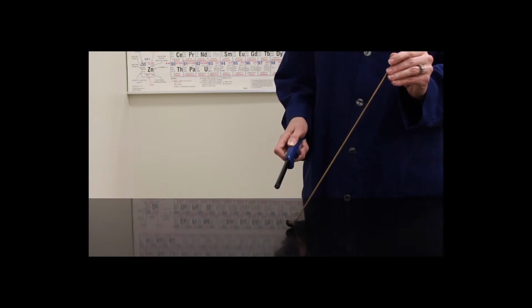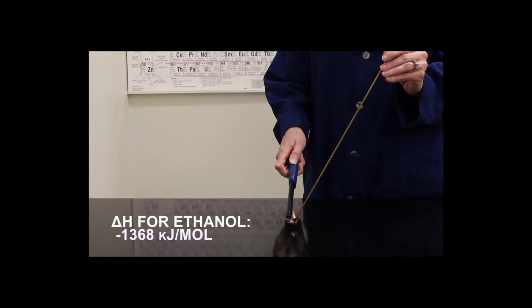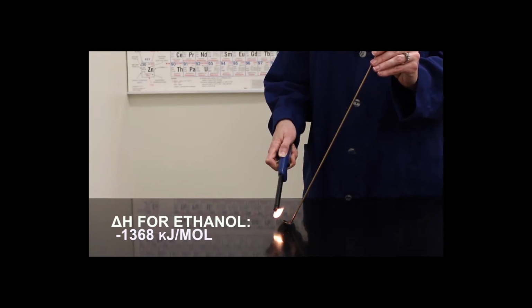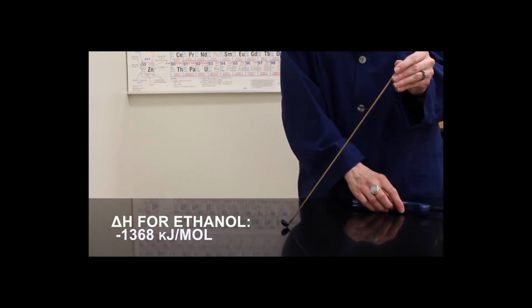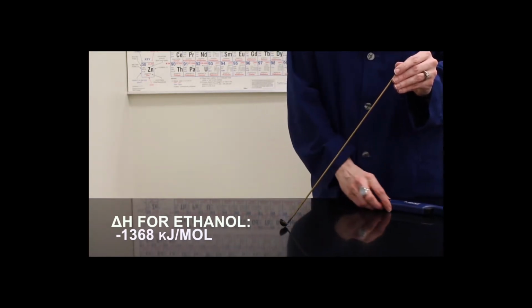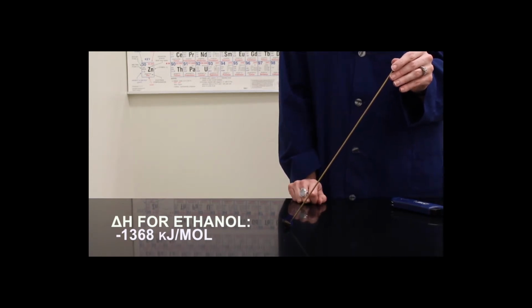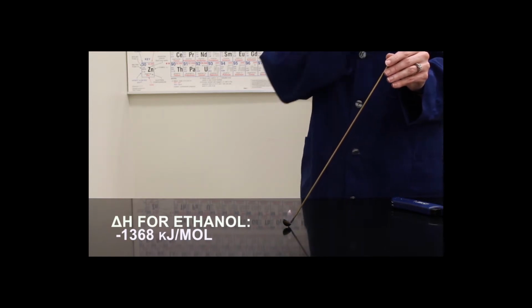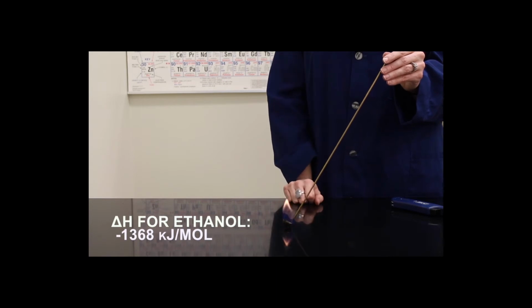The first substance we're going to burn is ethanol. Ethanol is a relatively small molecule, and we're going to have a small flame due to a small heat of reaction. We can see that the flame is very blue, and I can feel that there's not a lot of heat being released from this.